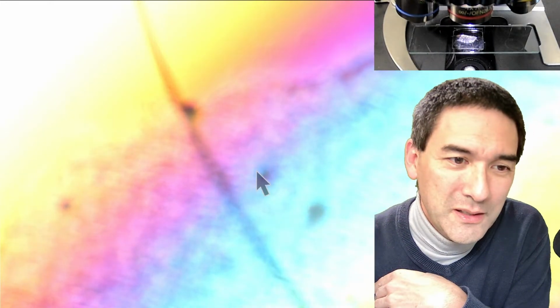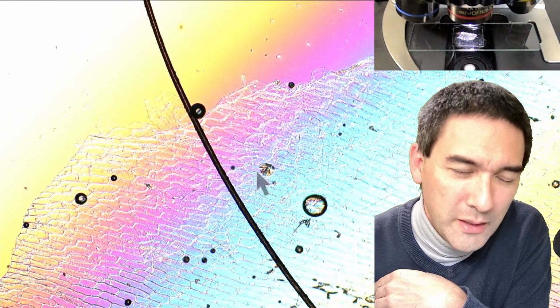Then it's not parfocal. So in other words, if you do not have objectives from the same series with a different focus, then you can adjust by inserting tiny discs where you put in the objective. It cannot go all the way in, and this way you can adjust parfocality. This was a little unexpected. Now it's in here, so I hope this improves the situation. I don't know why it came loose.